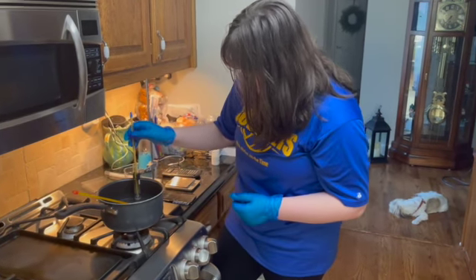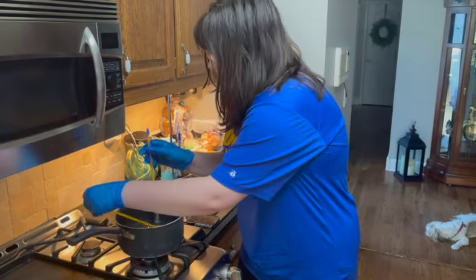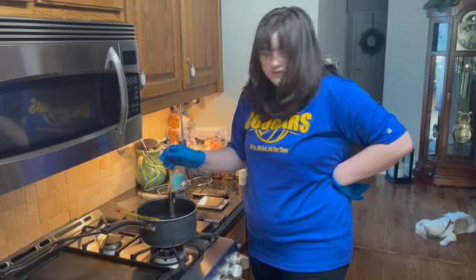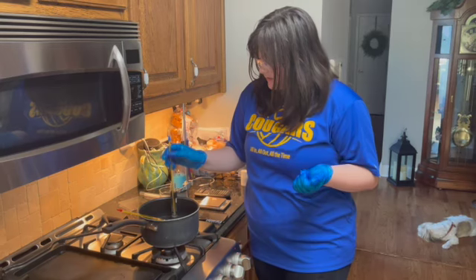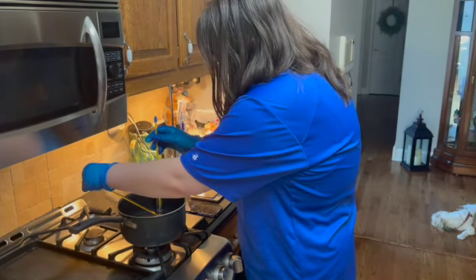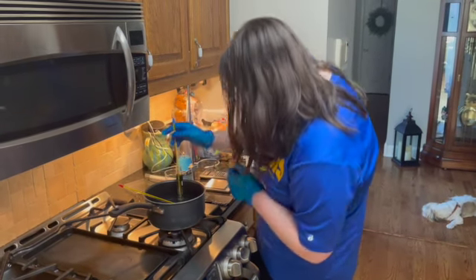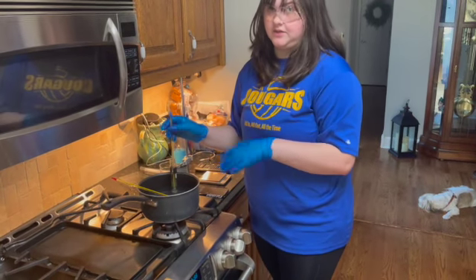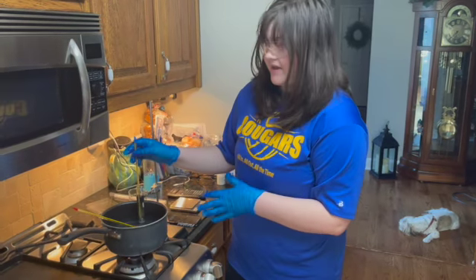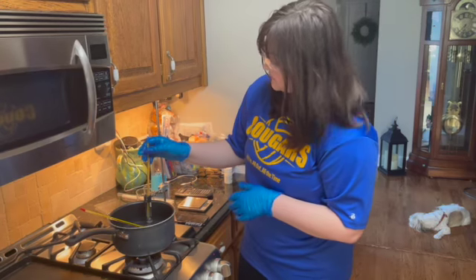So now we are at minute 12, and our solvent is at 54 degrees Celsius, and our hot bath has gone down to 54 as well. So they are relatively close, especially in their degree to what it's needing. For the hot bath, it's relatively at a 54.5, but our solvent looks to be at more of a 54.2, where it's a lot closer to the 54 than the 55. So that's why I'm making a clear distinction that our hot bath is closer to 55 than it would be to 54, and our solvent is close to our 54.